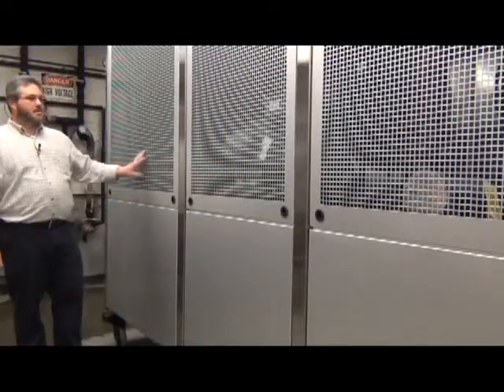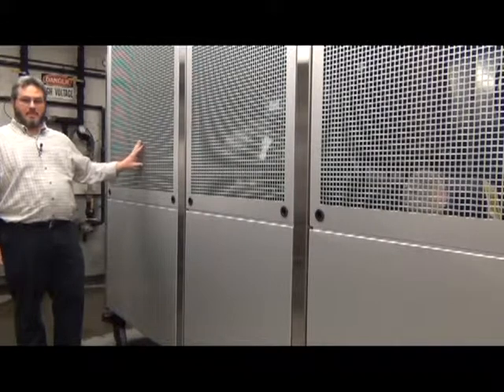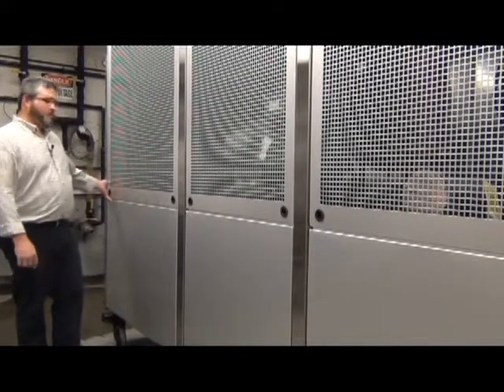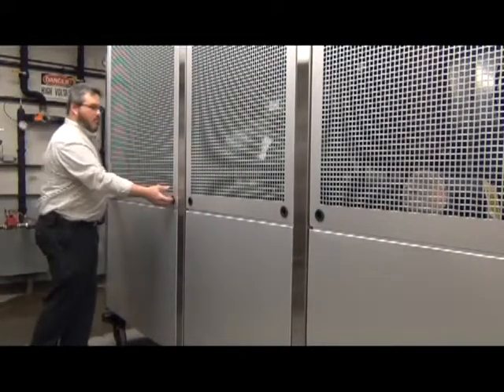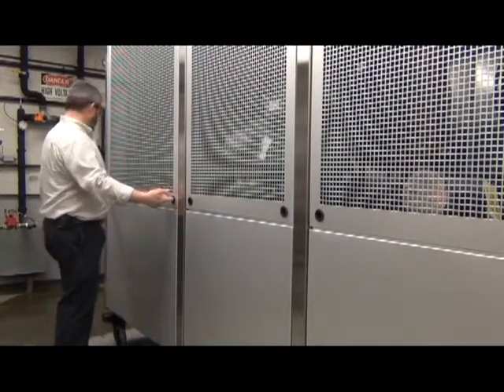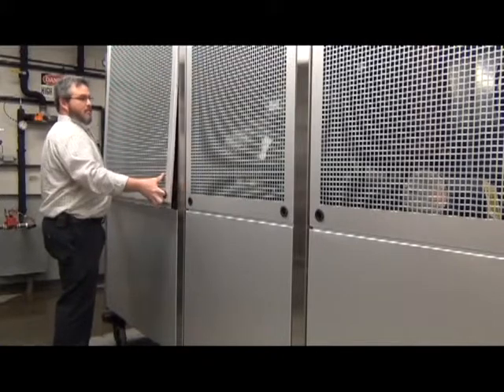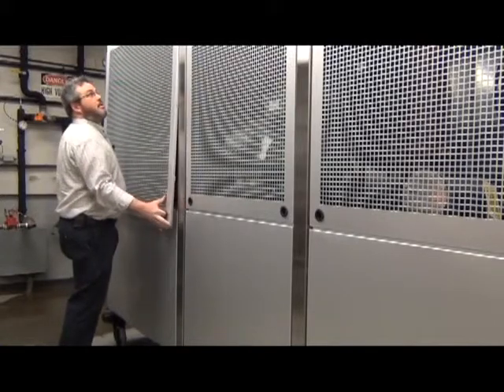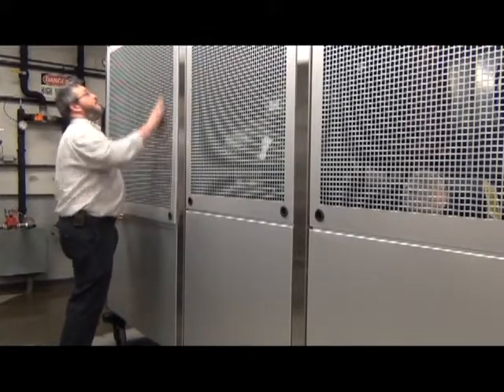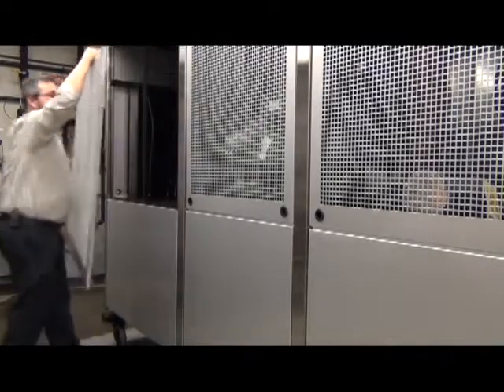In order to access the inside of the chiller and gain access to the manual, you'll remove the panels. Start by removing the top panels by placing your fingers in these grommets here, lift up, pull out, and then the cover will slide down. And just set that aside.